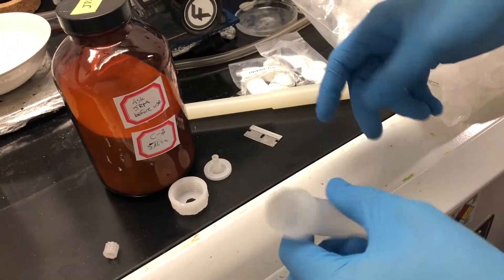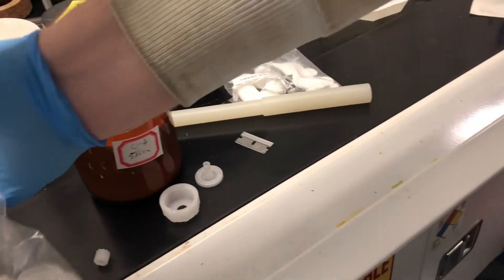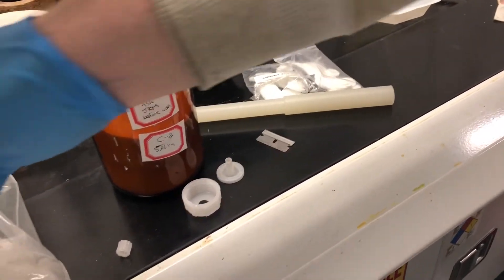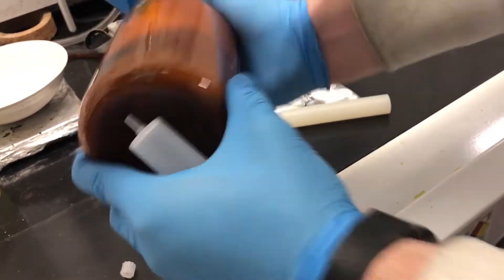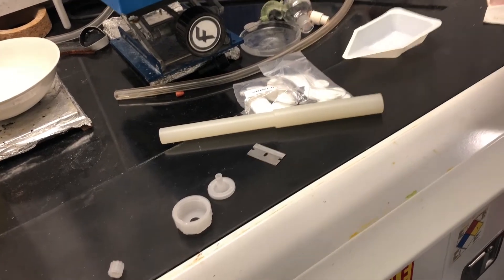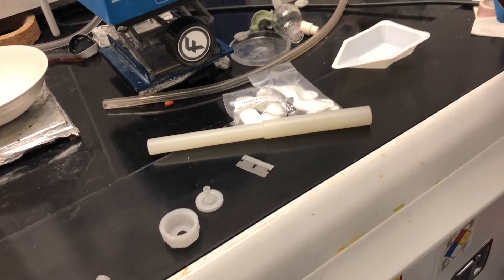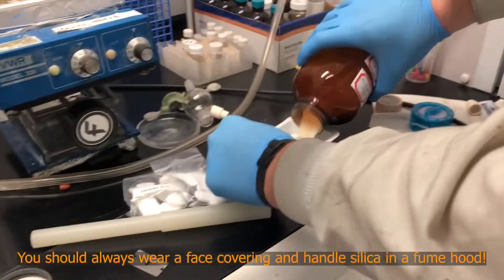Once you have the lower frit in, now we're going to add our silica. If I take a little bit of the C2 silica, you want to make sure it's a nice fine dry powder. That's what silica is. You're going to add it to your weighing pan.